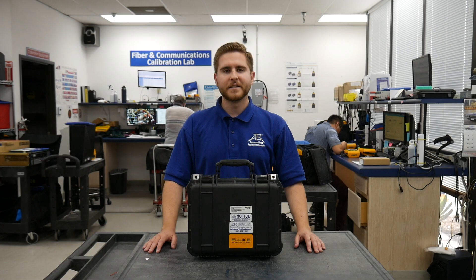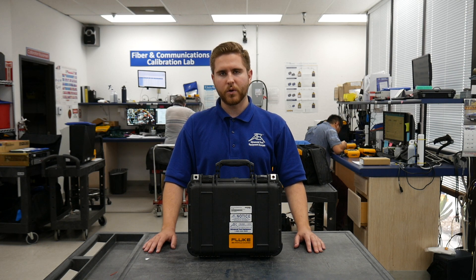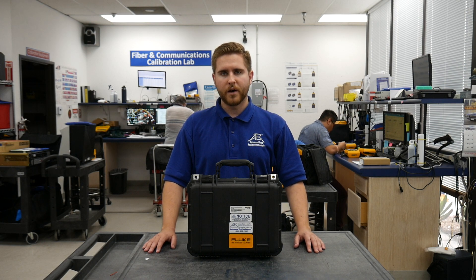Now let's head over to our lab to demonstrate air quality measurement. Today we're going to be measuring and analyzing air quality with the Fluke 985 particle counter.